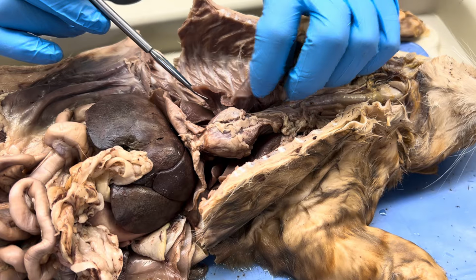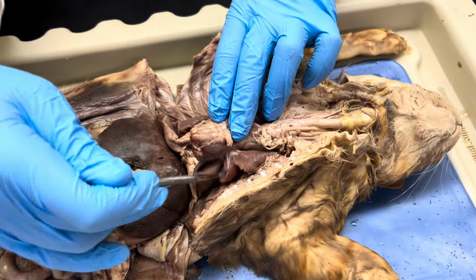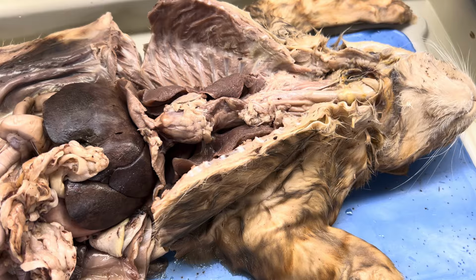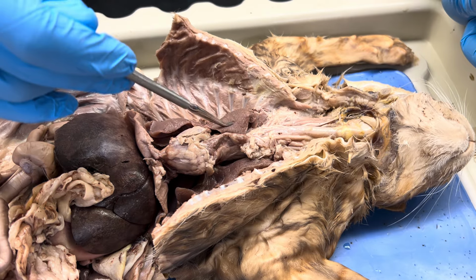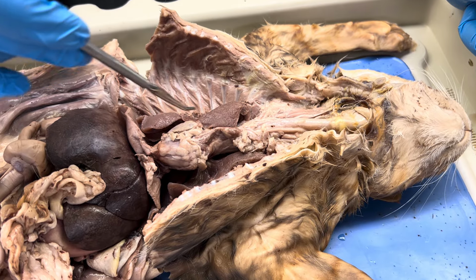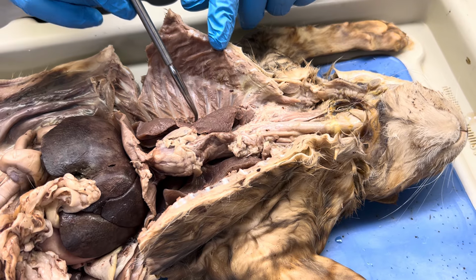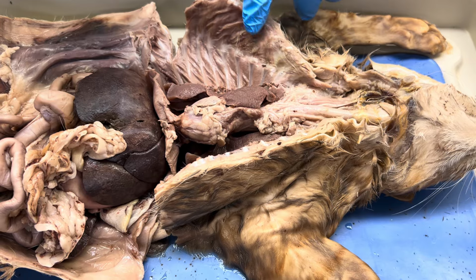But this would be its right lung, and on the opposite side over here, that would be its left lung, kind of hanging out over there. All right, right and left lung. But the reason I brought up the pleura is because you have to remember how serous membranes are set up. There's a layer that's seen on the surface of the organ itself, which is the visceral layer. Then there's a layer that lines the wall of the cavity, the parietal layer. In between the two, which is literally this space that would be in between them, that's the pleural cavity.